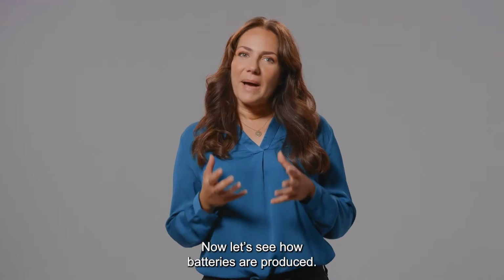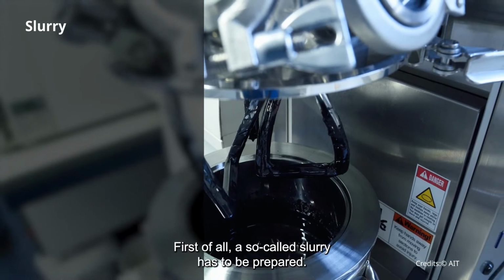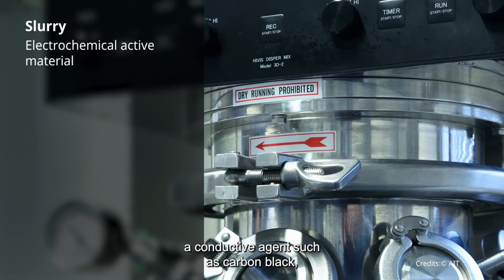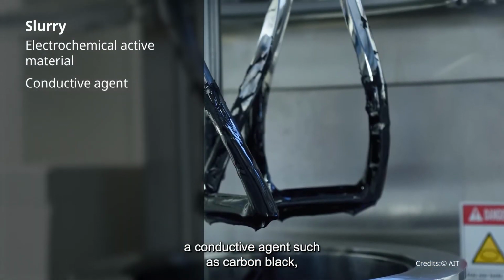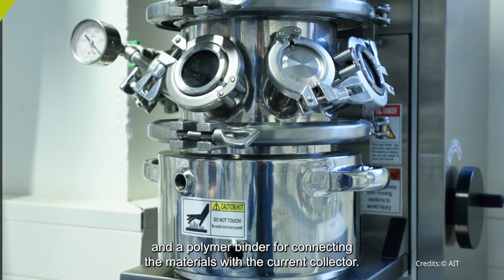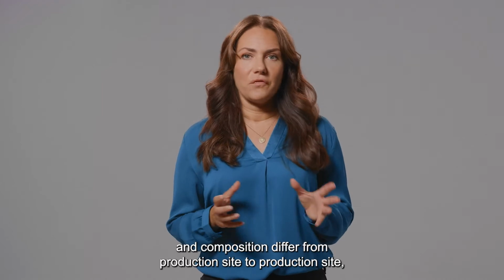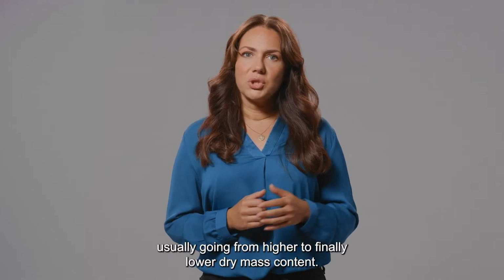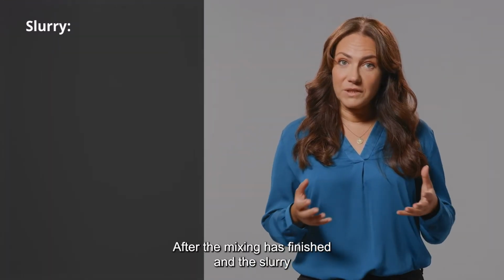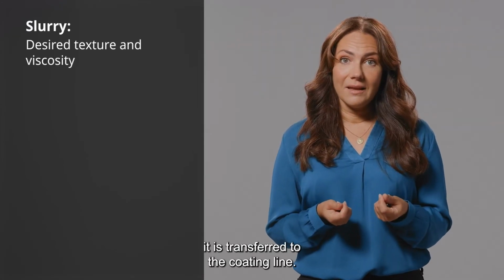Now, let's see how batteries are produced. First of all, a so-called slurry has to be prepared. A slurry consists of the electrochemical active material, a conductive agent such as carbon black, and a polymer binder for connecting the materials with a current collector. The mixing procedure, speed, and composition differ from production site to production site, usually going from higher to finally lower dry mass content.